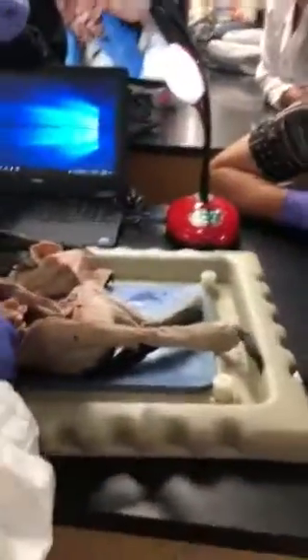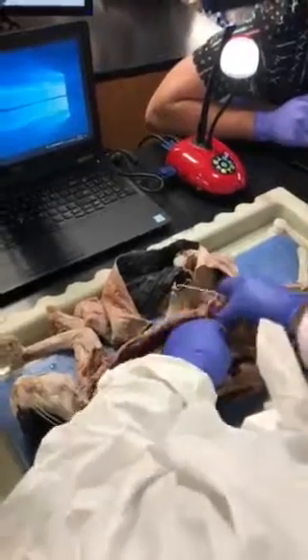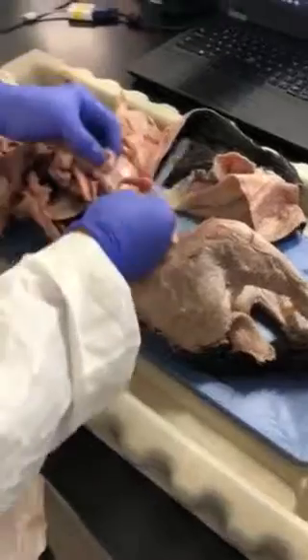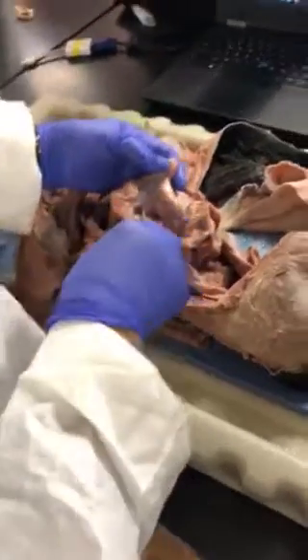You already know what the first straight region of the small intestine is — the duodenum. To know if it's already the ileum part: that's why when you have your practical exam you should have your gloves so you can hold the specimen and trace it, then try to look at where the junction is. You can see this is the cecum and this is the ileum part.